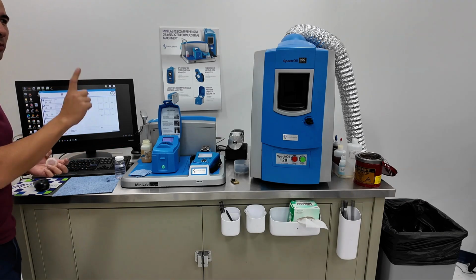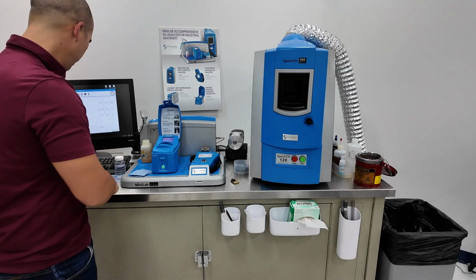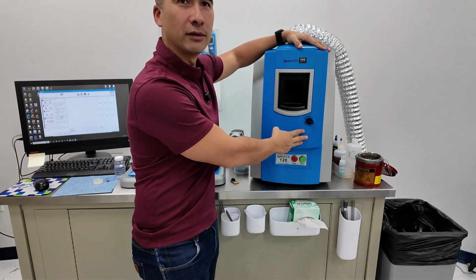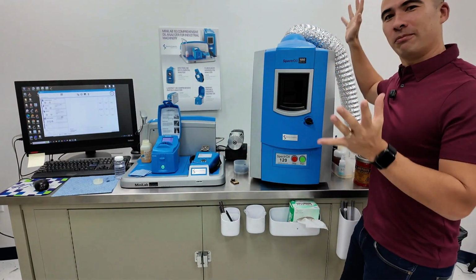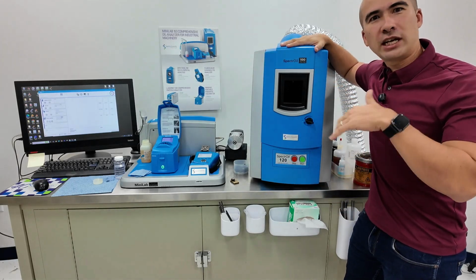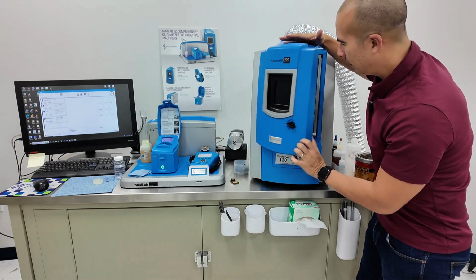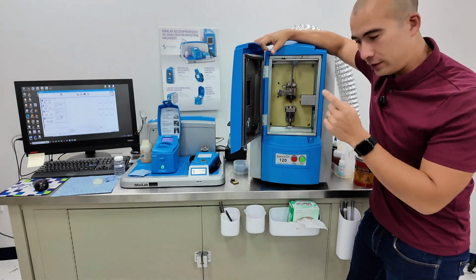In the meantime, we might look at the elemental analysis by rotating disc electrode. This is the big boy, and also the one that's the most fun, because it makes sounds and does stuff. So, Spectro Oil. There are a couple of different versions of this, basically testing different elements, as the calibration set up on the inside is a little different. This is the guts of everything. A couple of things to note.